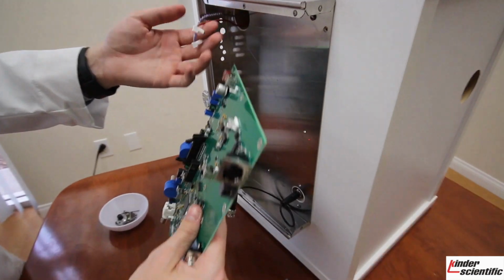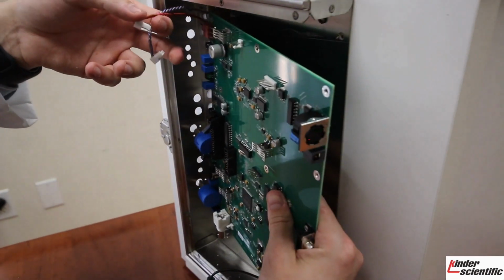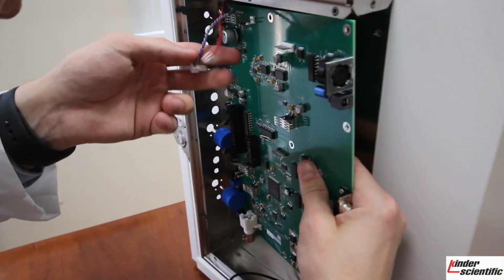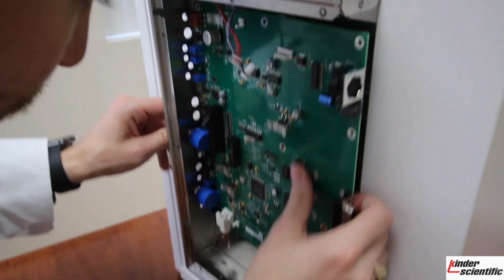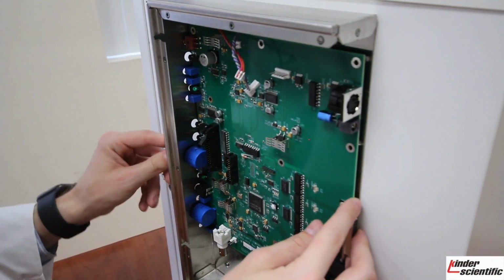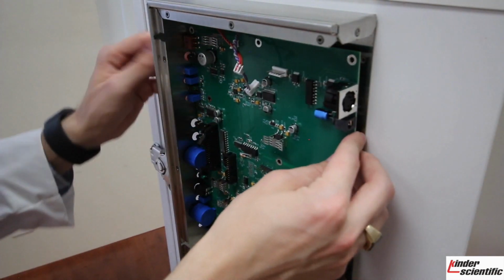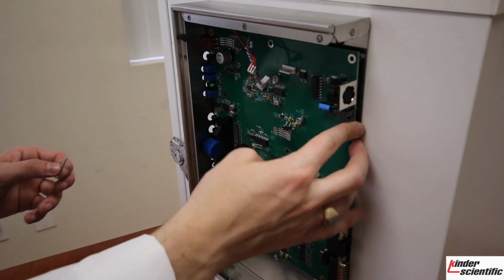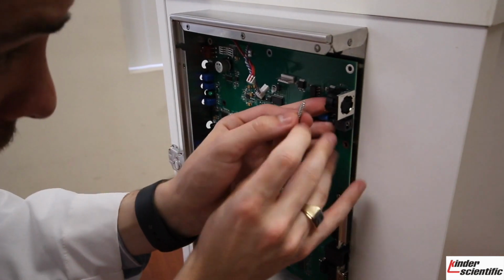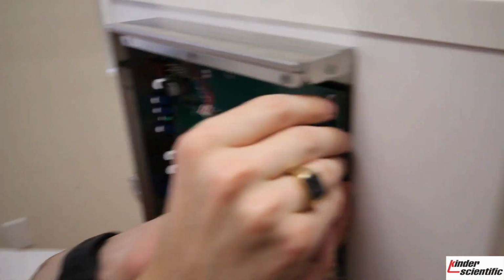keeping these here so that way they can connect back onto your ports, and slowly reinsert or insert your new board like such, so that way your vernier dials and your house light switch are sticking through. Once you have this back in place where it should be, go ahead and take your screws, and you will begin screwing them back into the 4 corners that you removed them from.